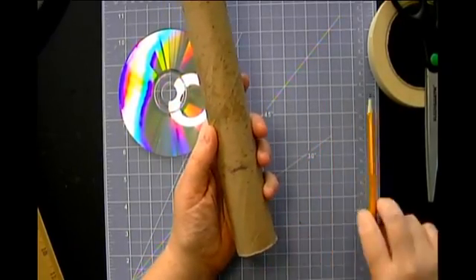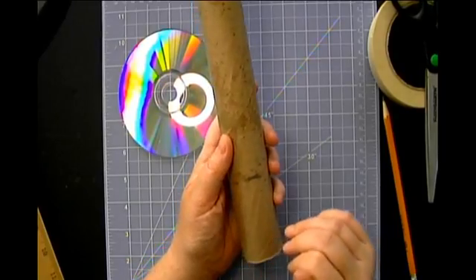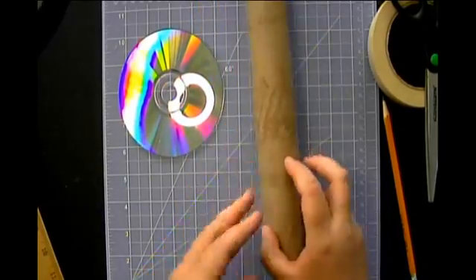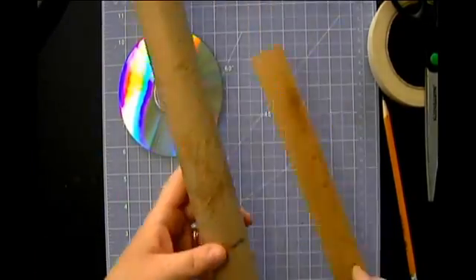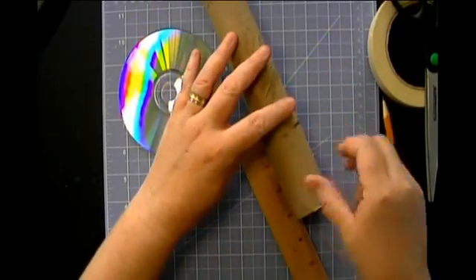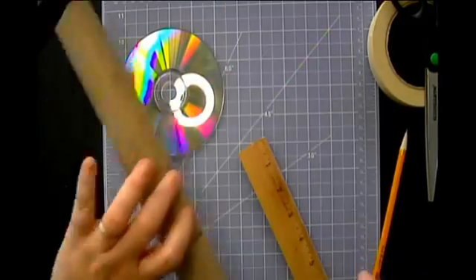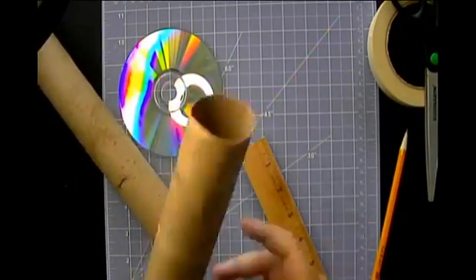And you can eyeball this if you don't feel like measuring. I just like to measure it because I feel like it gives me a little bit better results. I'm also going to mark 3 inches on the other side because my viewing window I want to be lined up with where my CD is. So let me show you that on this one.